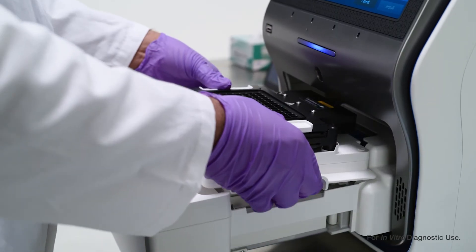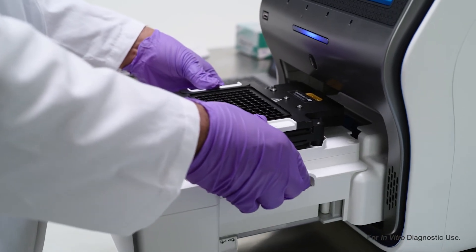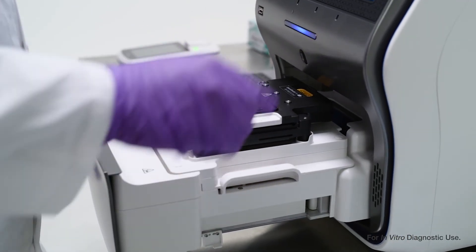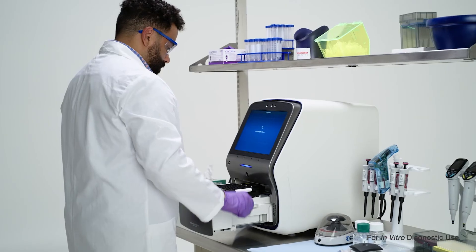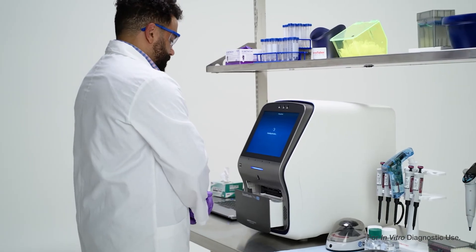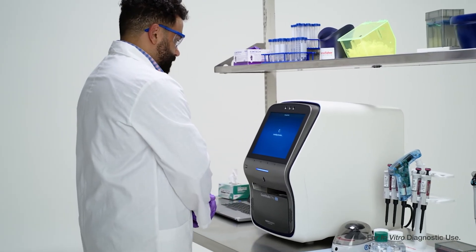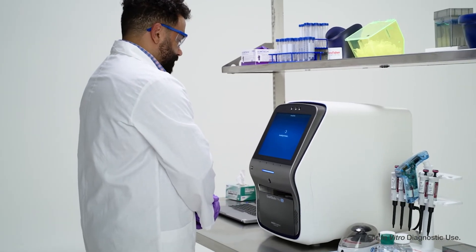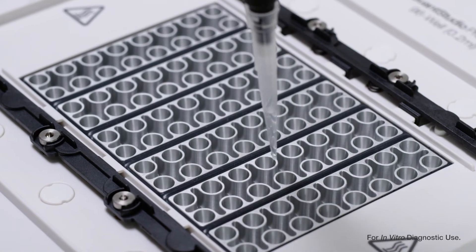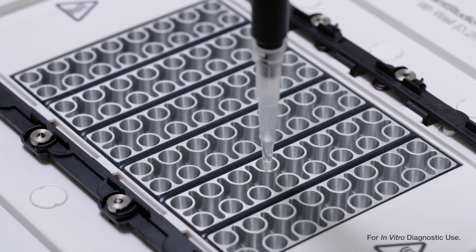Finally, reinstall the block and heated cover and run another background check. If contamination persists, repeat the cleaning process again using a 10% bleach solution. Rinse with water afterward.